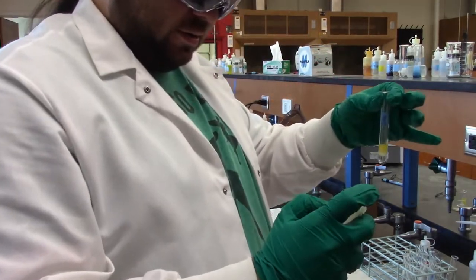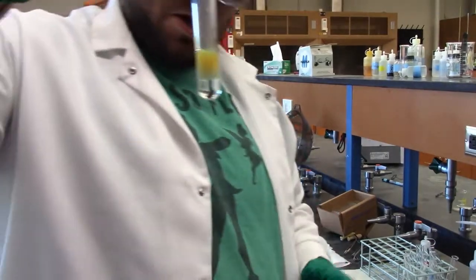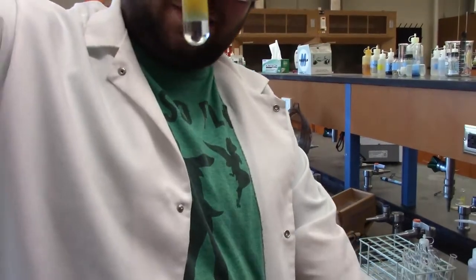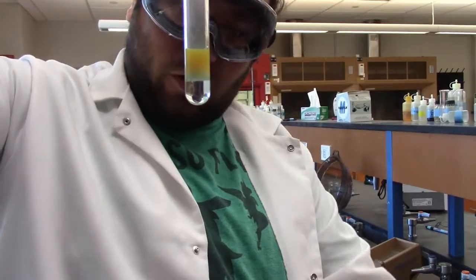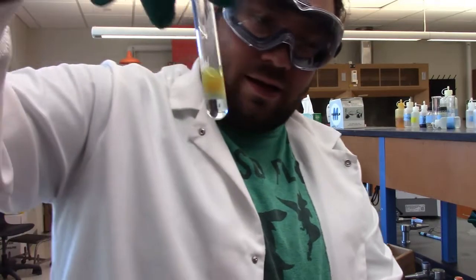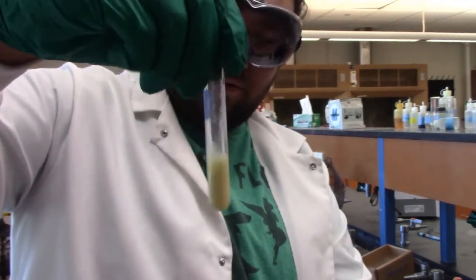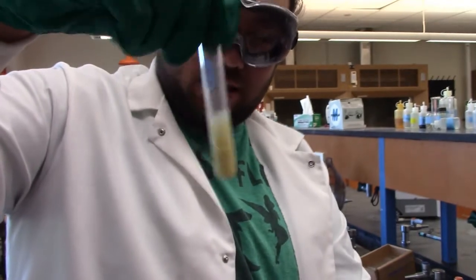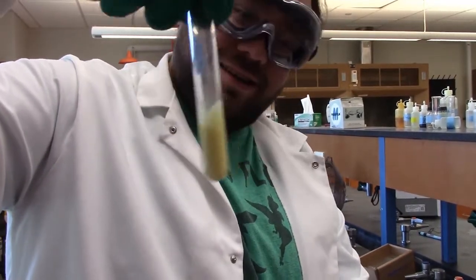Everybody at home go, ew. Yeah, so now you can see a nice distinct color change there. We still kind of got that pale blue solution on the bottom, got a layer of our white cloudiness, and we got a nice yellow color up top. And I'll give it a good shake to mix it all together now. And now we've kind of just got a uniform, cloudy yellow color. Doesn't that look beautiful?